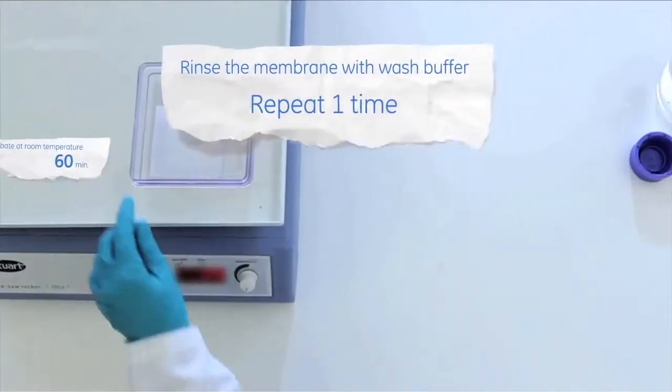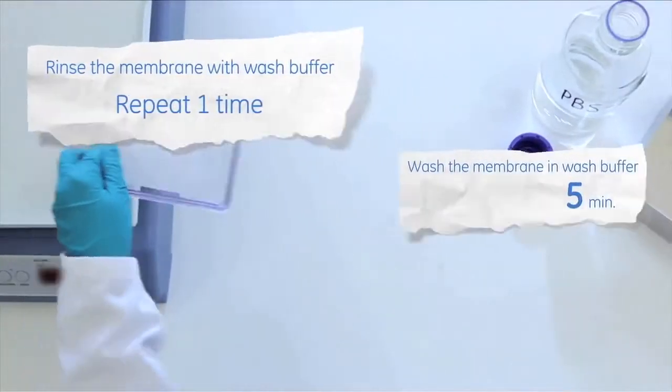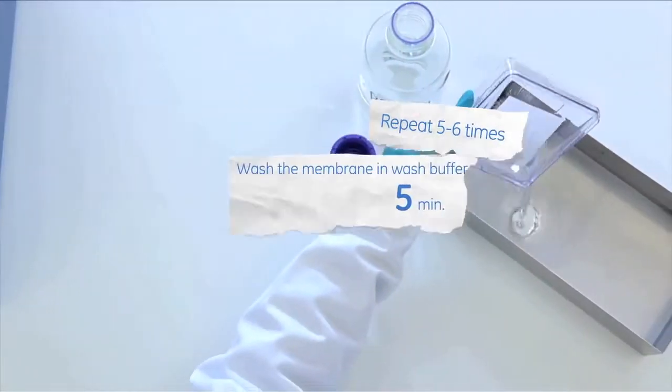Rinse the membrane twice with wash buffer, then wash in wash buffer for 5 minutes. Repeat 5 or 6 times.